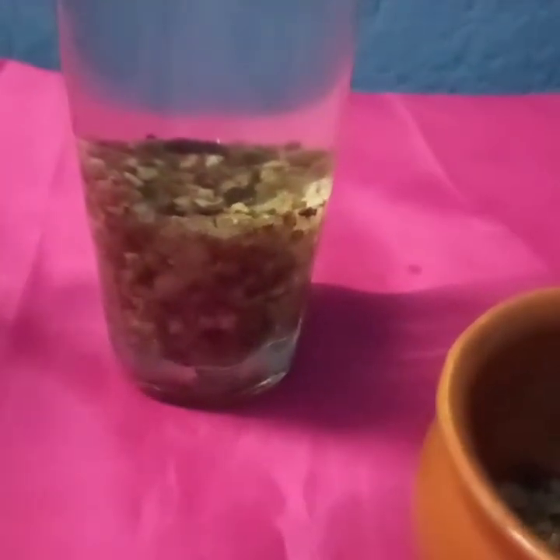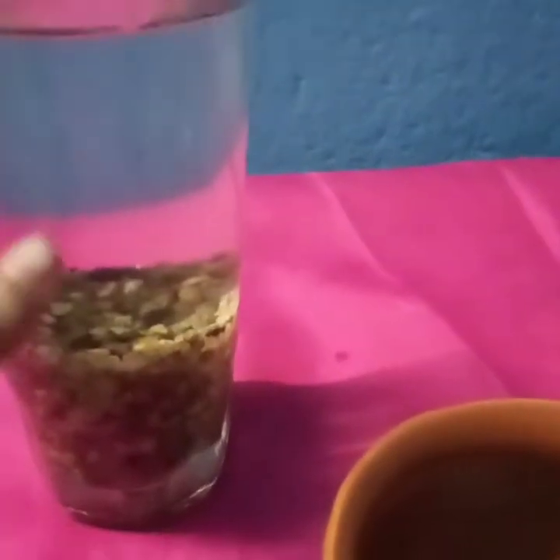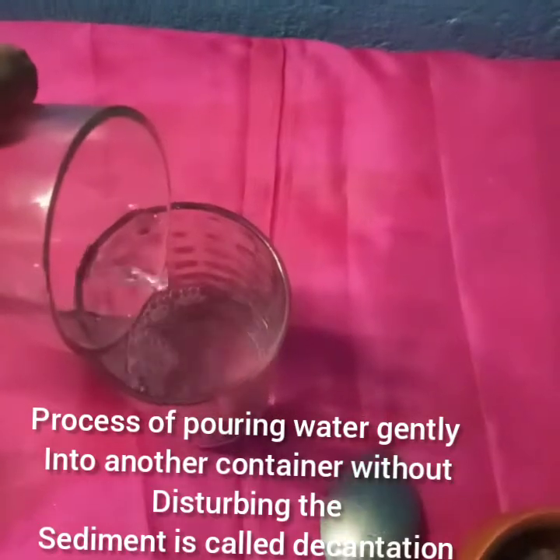Now what we have to do is to transfer the water you are seeing above to another container or another beaker. We have given 10 minutes to this beaker so that the sand can settle down. Now we will be gently pouring this water into another beaker. Now we have poured it.